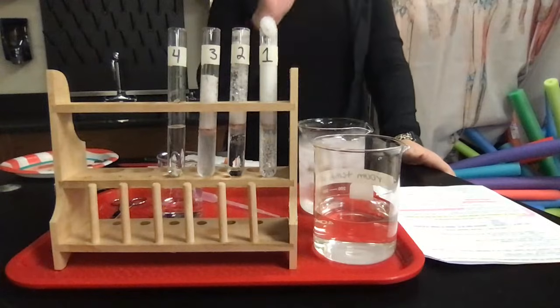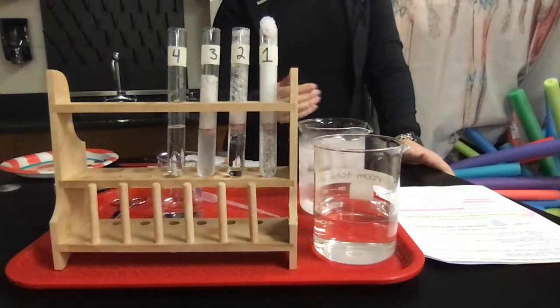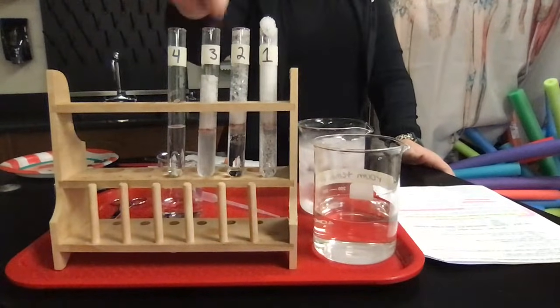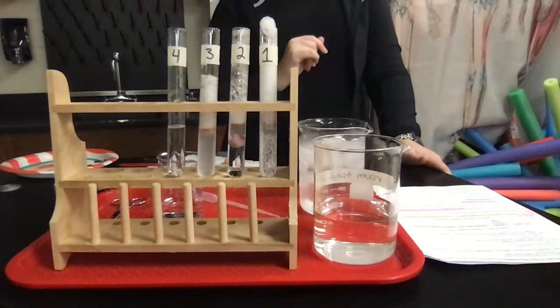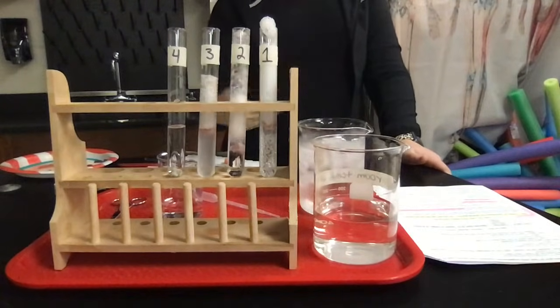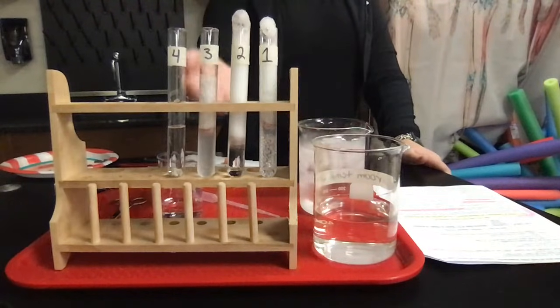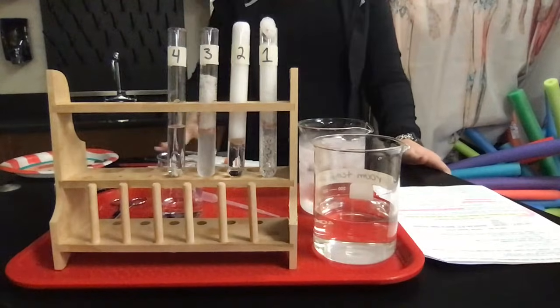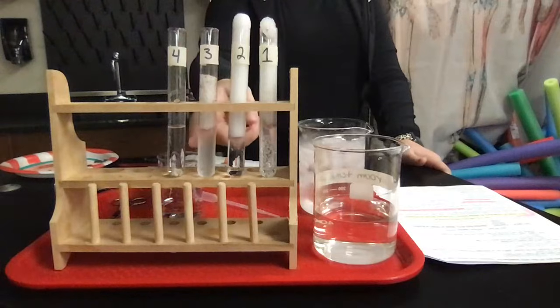Remember that this reaction is an exothermic reaction, right? It means it's releasing heat. So as soon as I put the liver, the catalase source, into this test tube, and as soon as it started reacting with that hydrogen peroxide, it's starting to create heat. Also, because I took this out of the ice bath so you could see the reaction, right? Oh, now this one's starting to take off too. Because I took this out of the ice water, now this is starting to heat up because of the temperature around us, right?